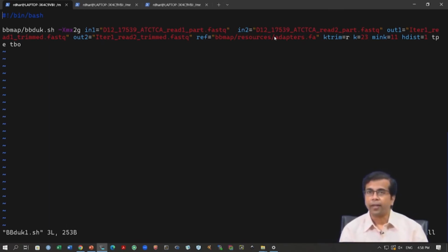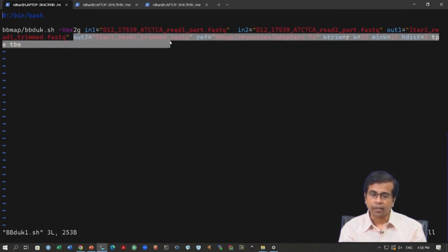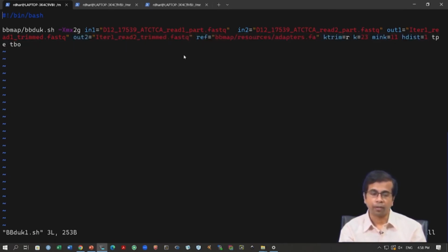Then you have the output file names that we can specify, and we can specify anything that we like. So, I have mentioned iteration1 read1 trim.fastq just to distinguish from the original file names. This is the read1 file, but this is also trimmed, and then I have also mentioned iteration1 because we might need multiple iterations to get to the optimal parameter or optimal data quality. That is why I mentioned iteration1. You have these two files, out2 also, because you have paired end data. If you are dealing with single end data, you do not need to mention this in2 or out2.